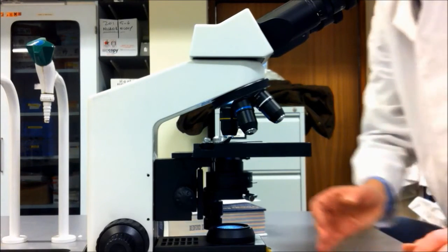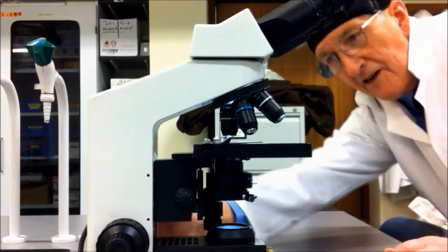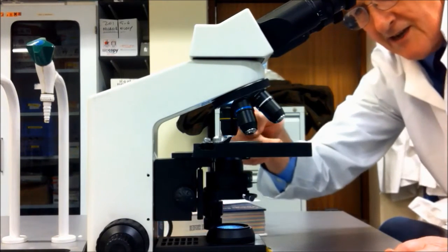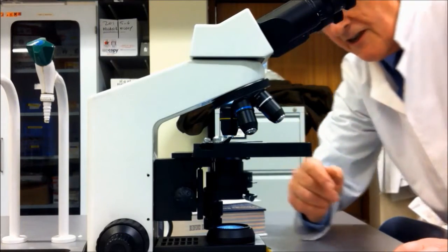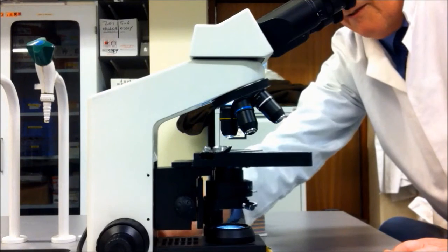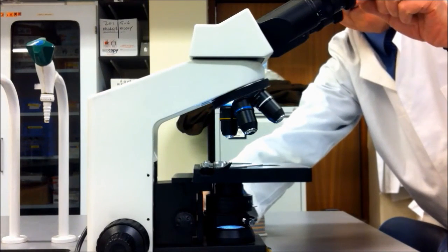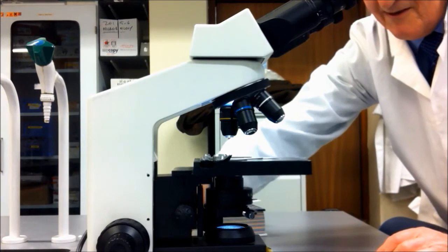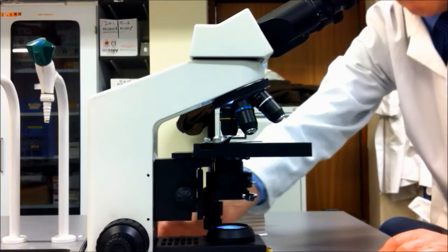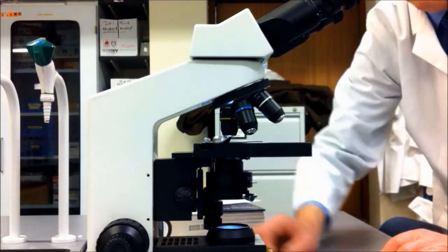When you're starting to use a microscope, it's always best to manually, from the side, turn the control knob so that the stage and the lens are as close as possible. That's much better than looking down the microscope and then crashing the lens through the slide. So always start as close as possible and track away.